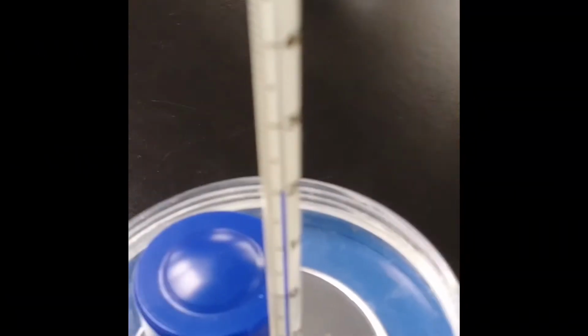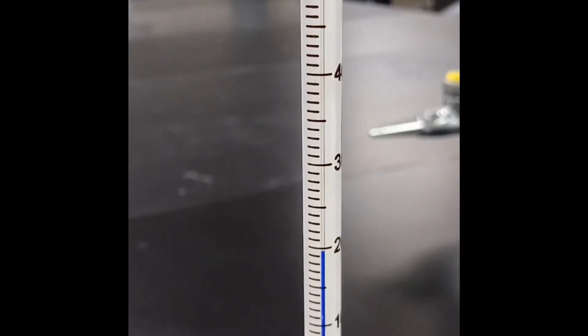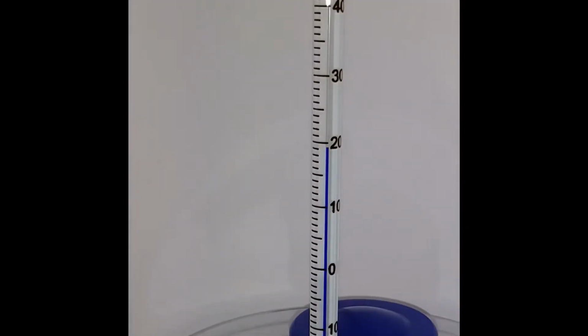We will then measure the temperature of the water before adding the ammonium nitrate. Please pause the video and record the initial temperature of the water before the ammonium nitrate is added. Next, we will add in our ammonium nitrate into our water and I'll give it a slight stir. And then we will record the temperature changes that is associated with this chemical process.